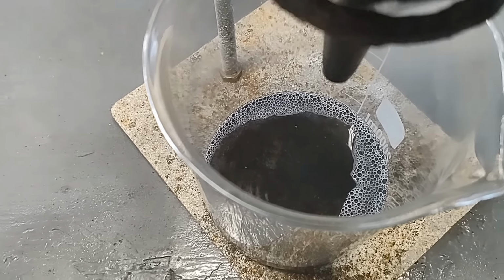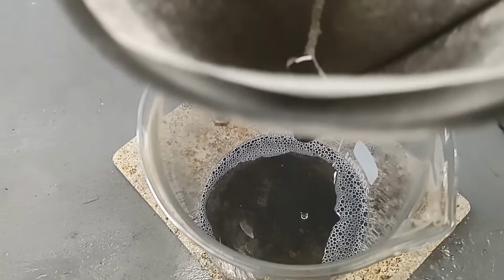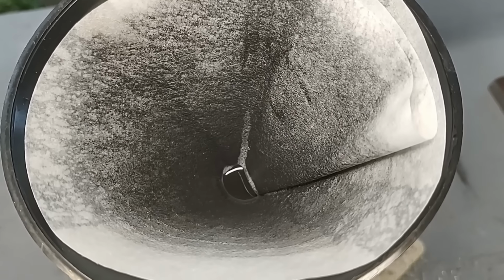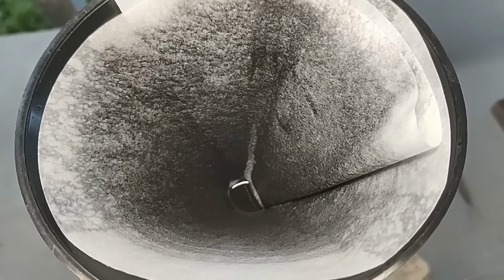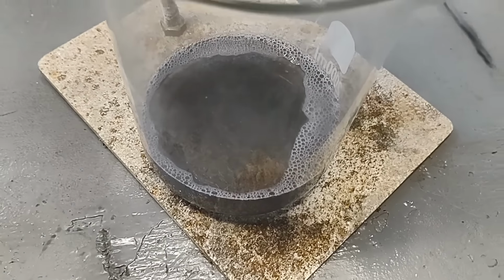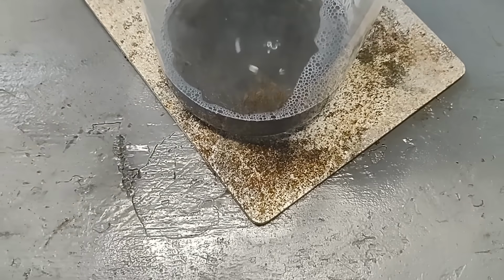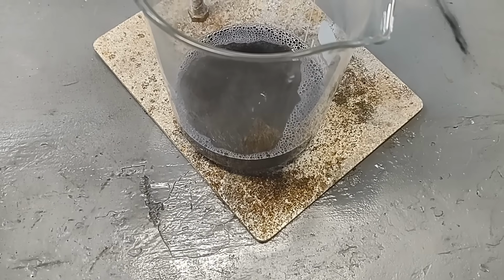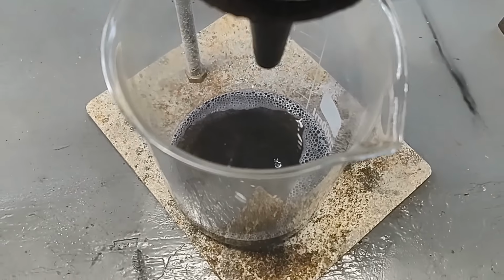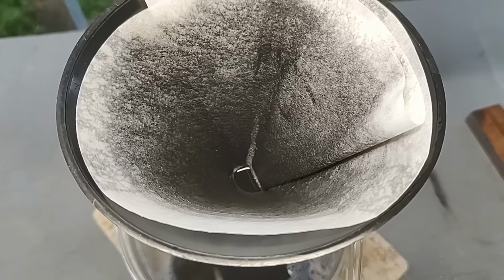Some of it even went through the filter and wound up down here in this beaker I've been using to catch the water. So the filter will go in my filter and rag storage, although I think I will use this filter to filter the boil water that comes off of the palladium too and catch any more palladium that comes over. And of course this liquid will go into my stock pot along with the fine little bit of powder that's made it through. Now I'm trying not to lose anything. I mean, there's been a lot of losses in this process so far, but I think this stuff doesn't amount to much of anything. It's just very fine stuff.